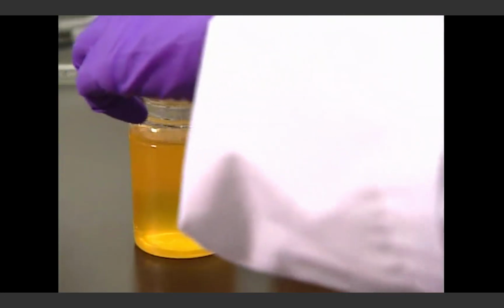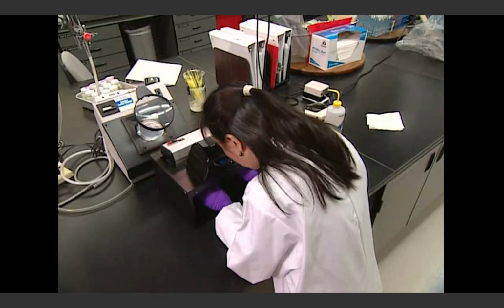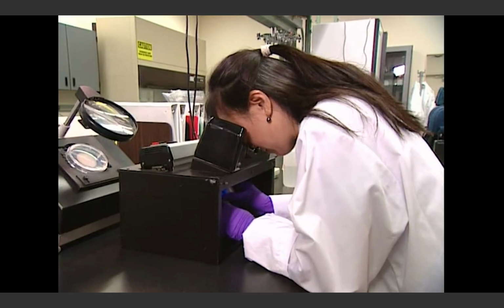When a water utility detects total coliform bacteria in a sample, their presence may or may not be an indication of a serious water contamination problem. Nonetheless, every total coliform positive sample must be checked just in case.